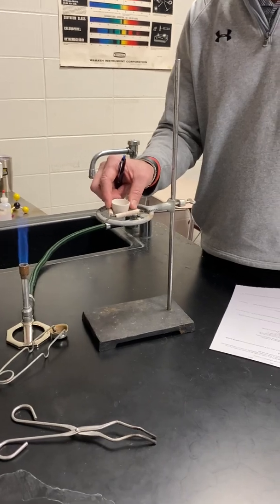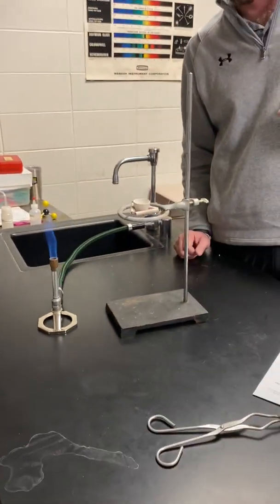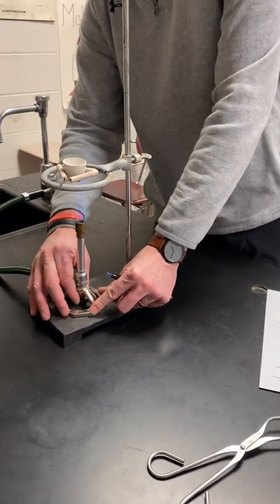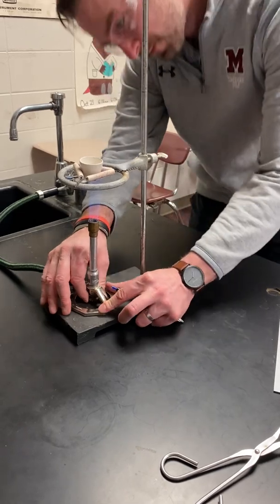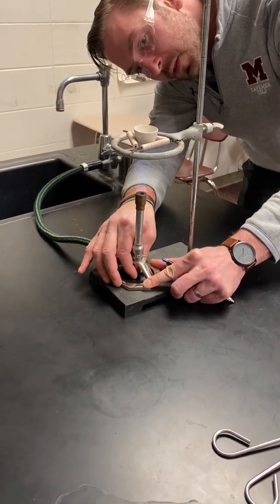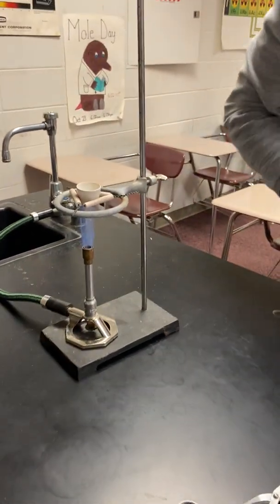We have our Bunsen burner set up. The clay triangle is going to hold the crucible in place. And we do want to heat the crucible slowly at first and then with a stronger flame. That's so we make sure that we don't crack the clay crucible right away. We want to bring it up to temperature. And so we're going to make sure that the bottom of that flame is a little more gentle. And we'll raise that Bunsen burner flame up here in a few minutes.